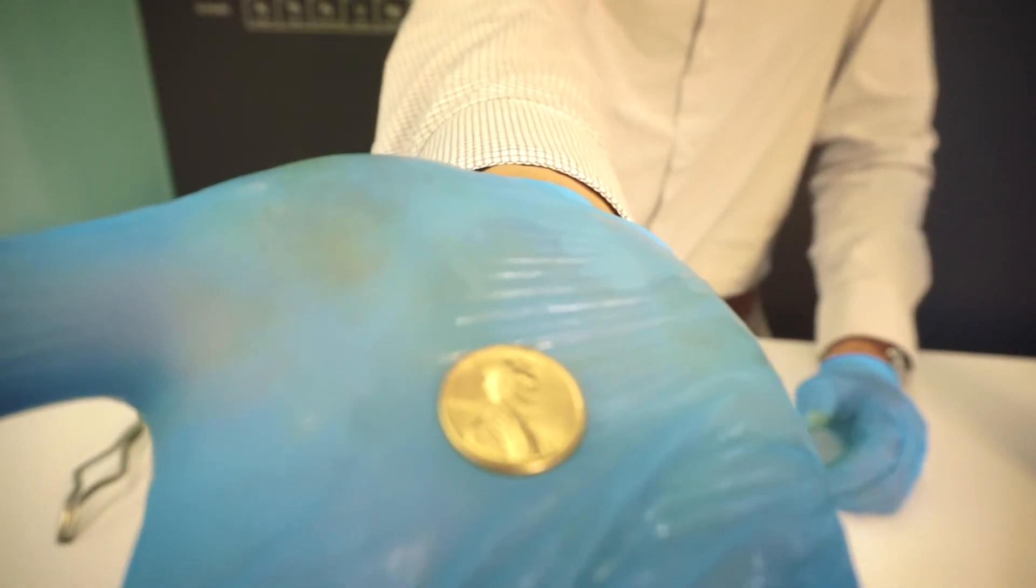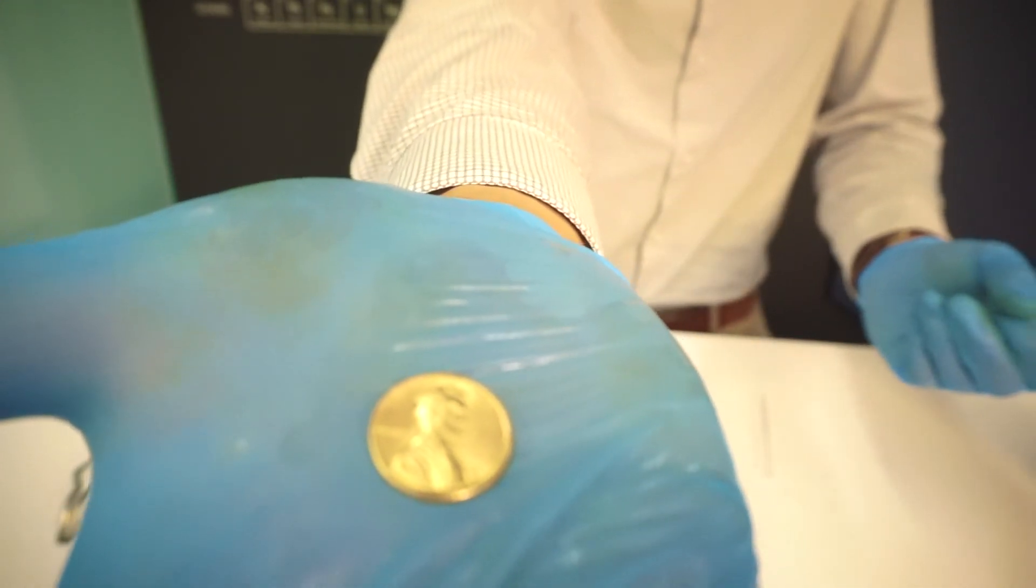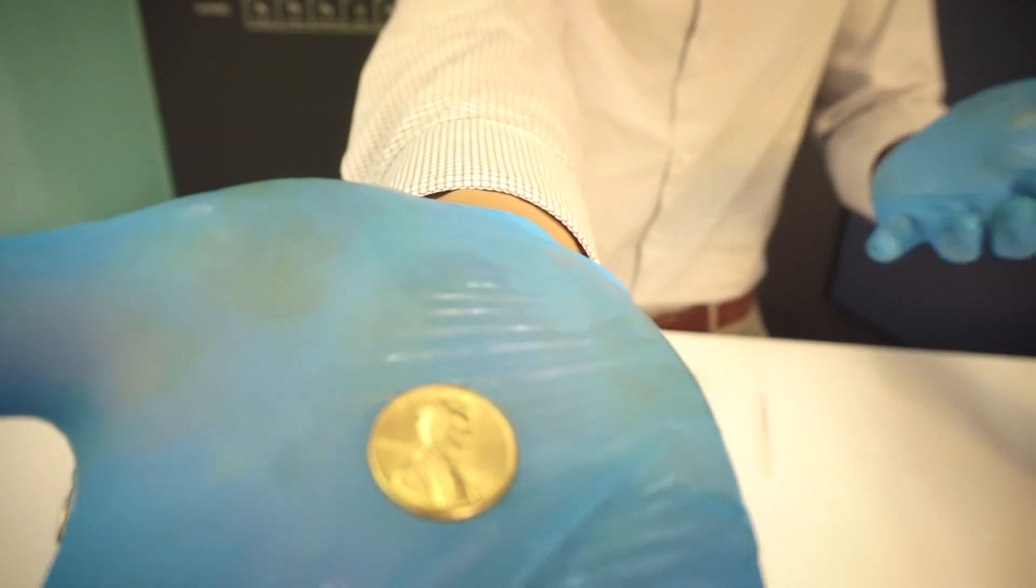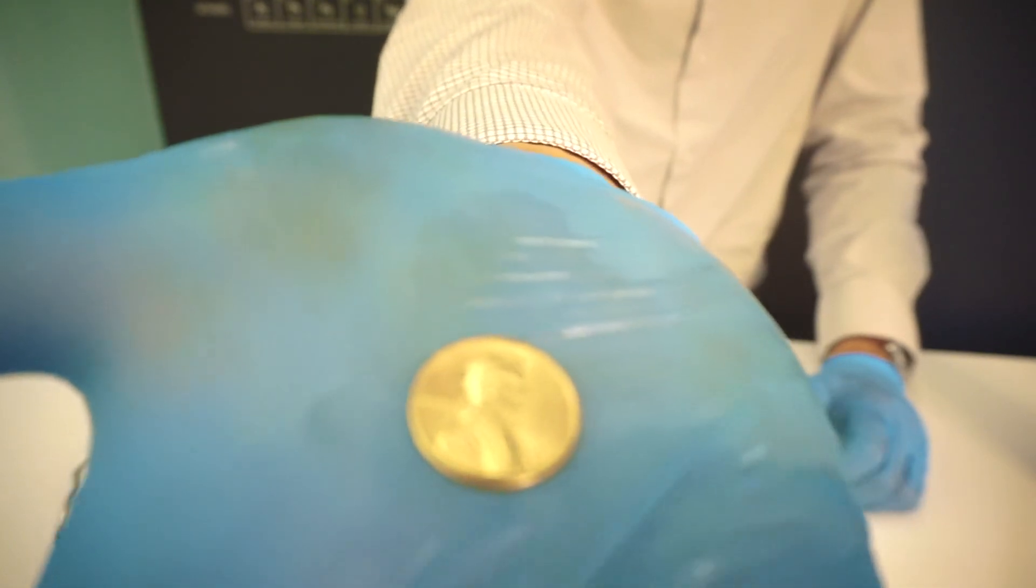What has happened is the zinc that we plated on top of the copper reacted with the copper that was underneath. And once it's heated, the zinc actually melted, formed a zinc-copper alloy, which is brass.